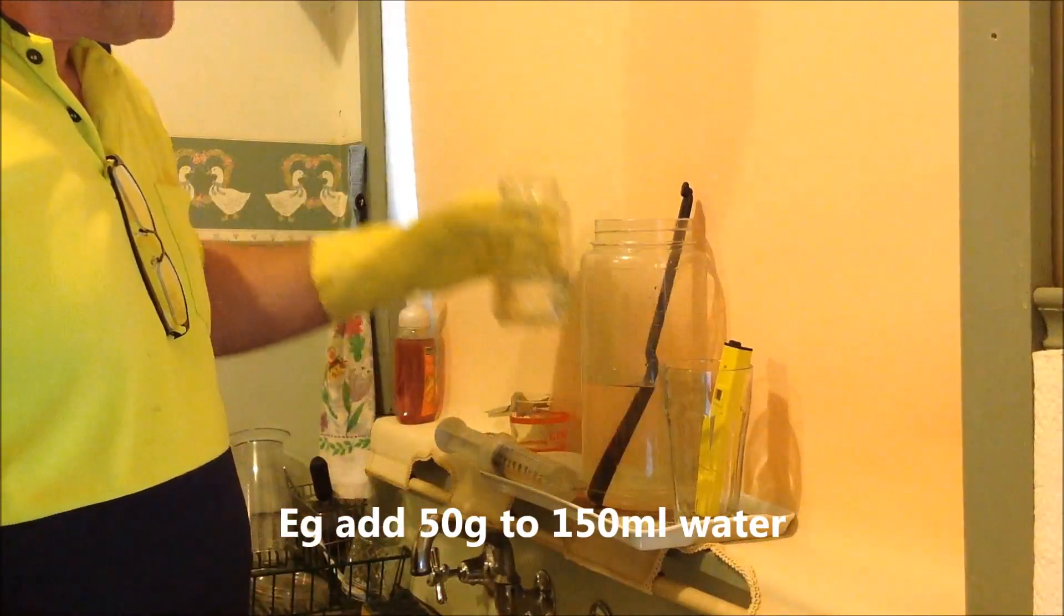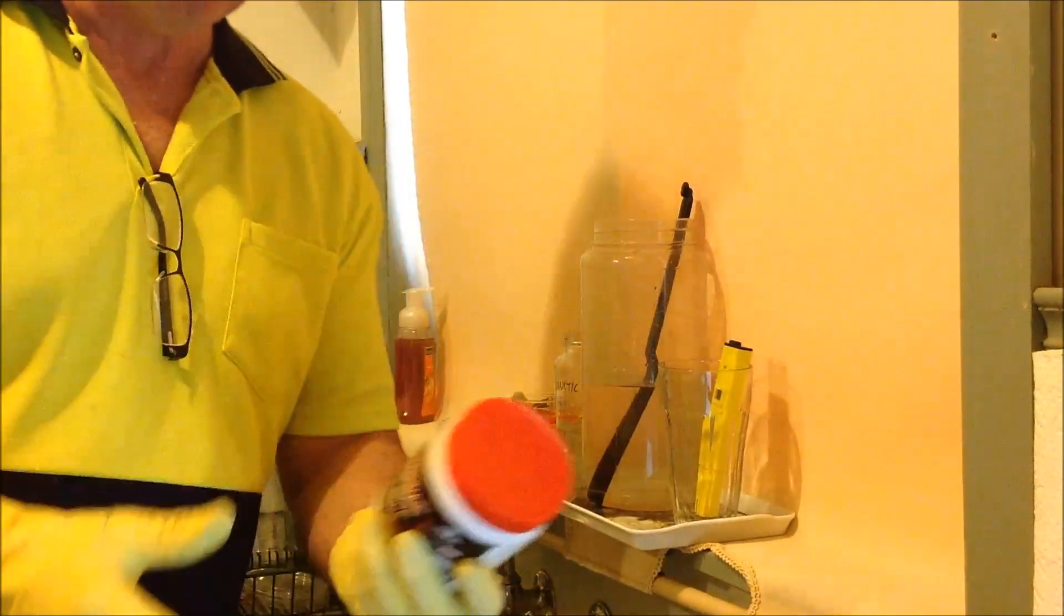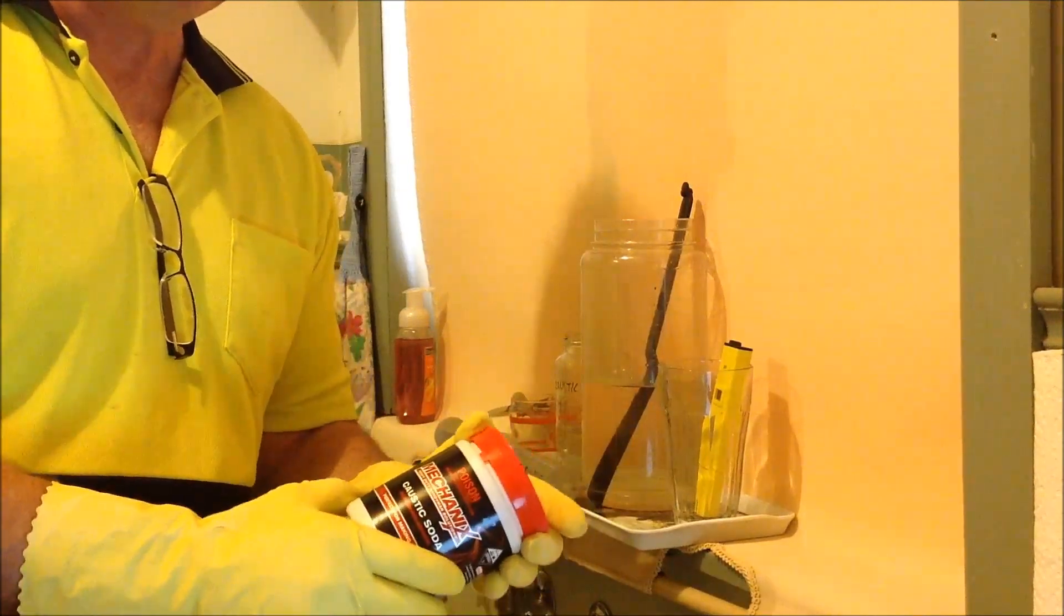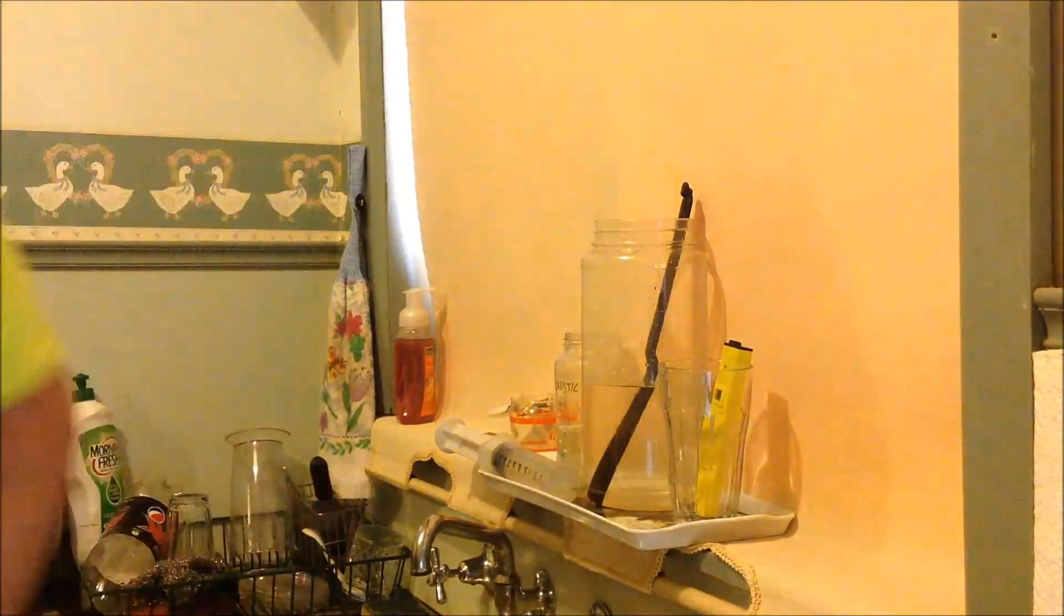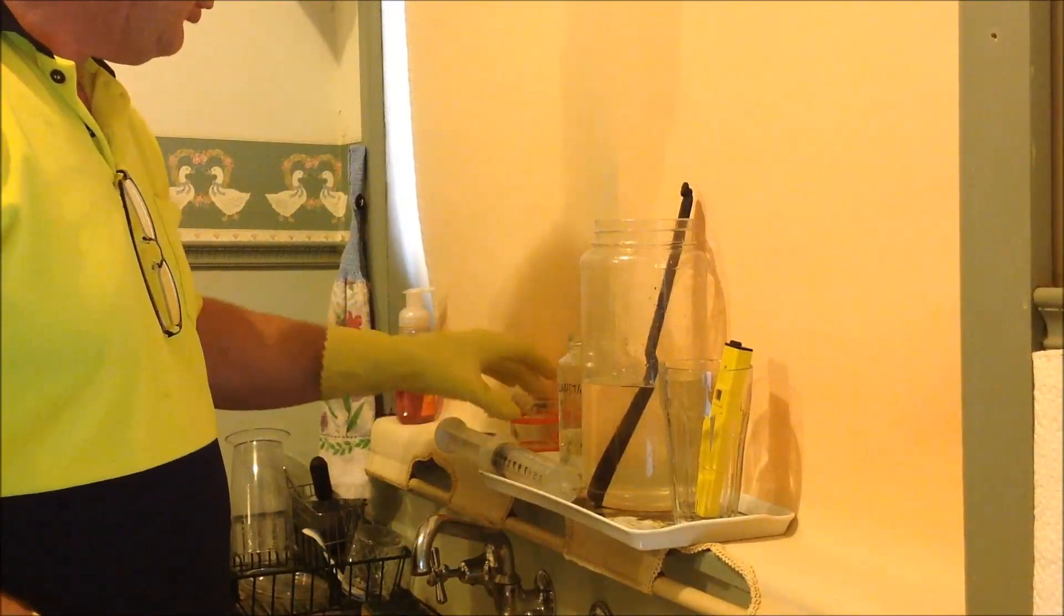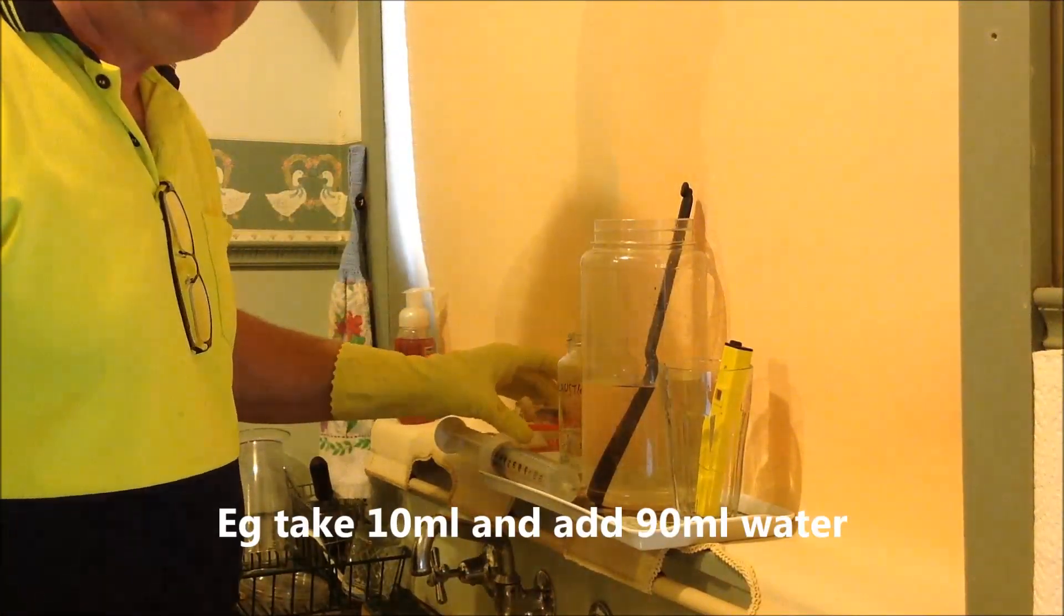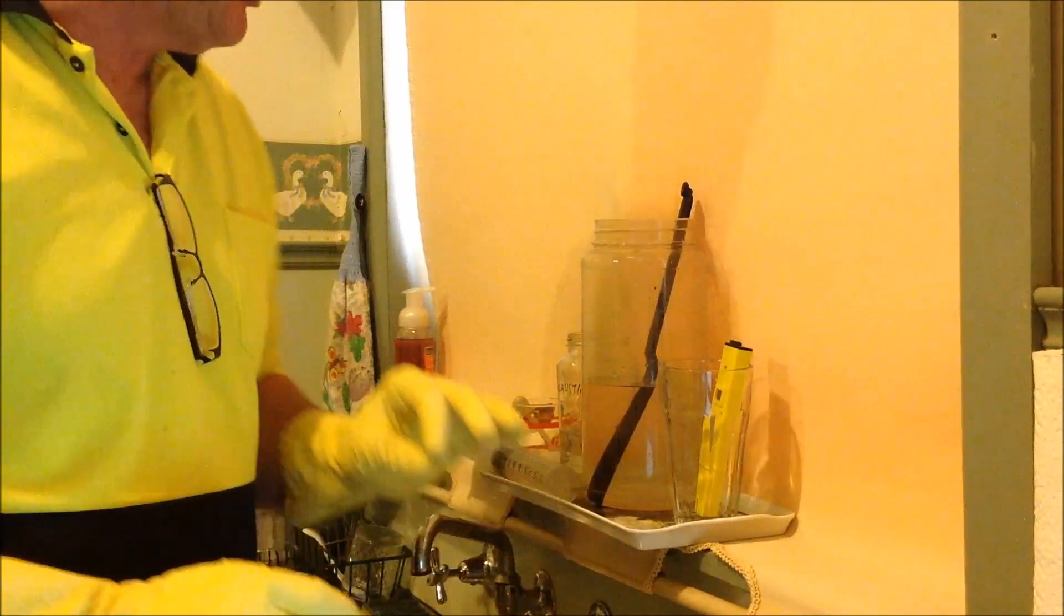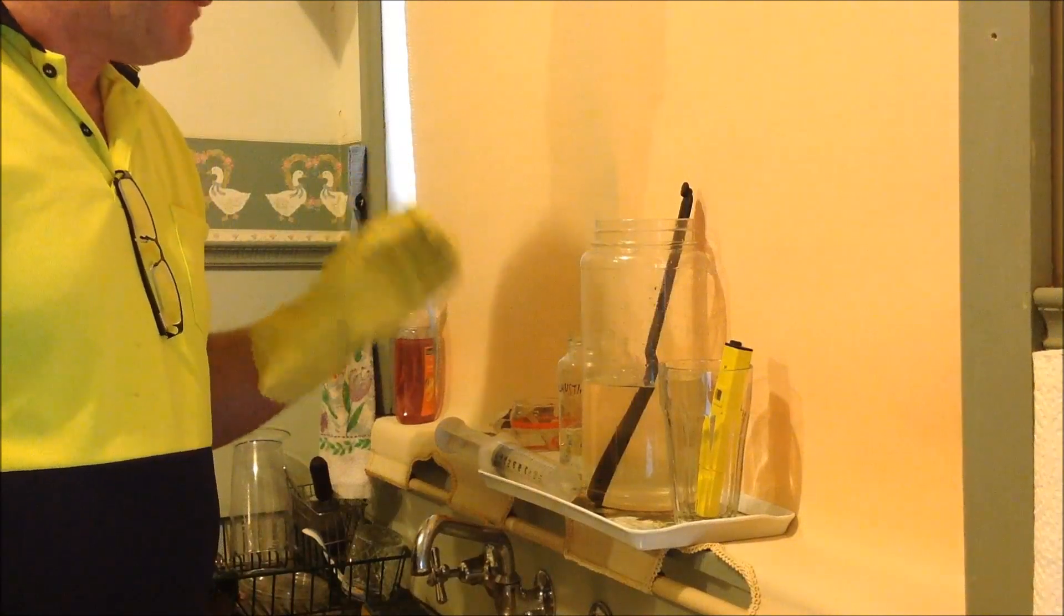So I've made up amounts a third by weight, so a 30% solution, and I find that works well because I buy my hydrochloric acid which we'll talk about later and it already comes as a solution made up to 30%, so it helps my headspace to have them both the same. And having made my 30% solution, then I also make a smaller amount of 10% of that, and the reason for that is that sometimes these reactions go quite fast towards the end and it's handy to make changeover to a more dilute solution.